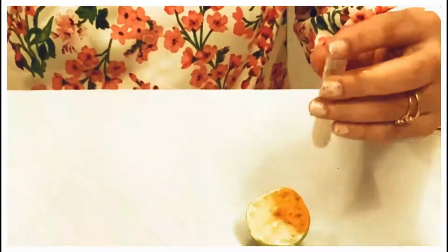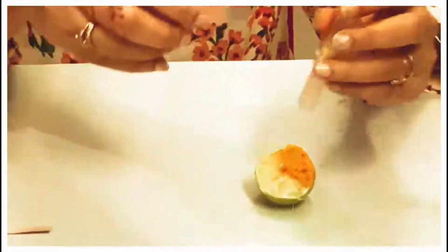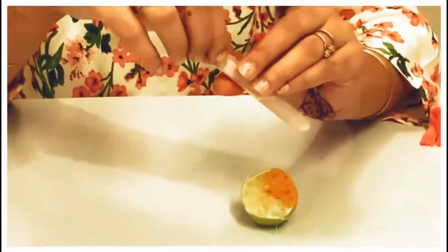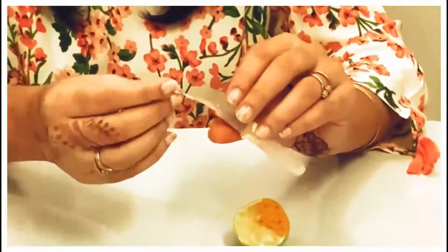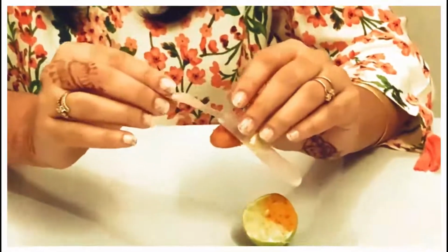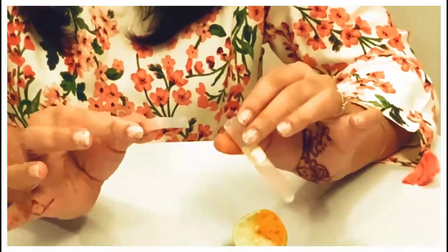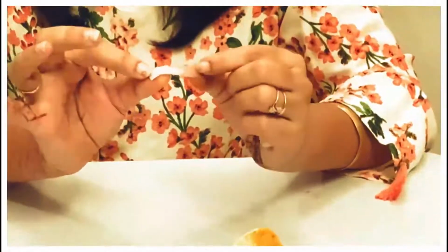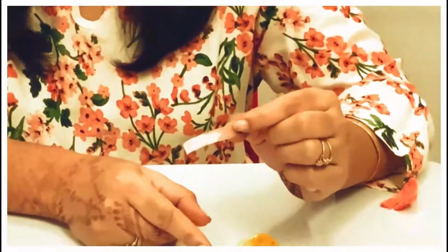So here I have taken more solution of base and now dip the litmus here. Just have a look. When I dipped red litmus into the solution of base, it turns into blue, while this red litmus did not have any change in the acids.